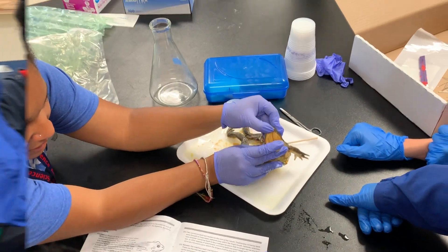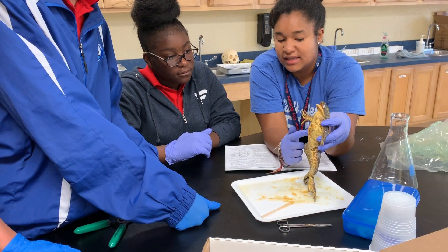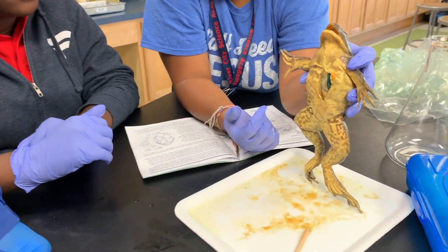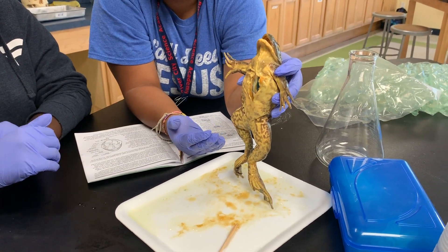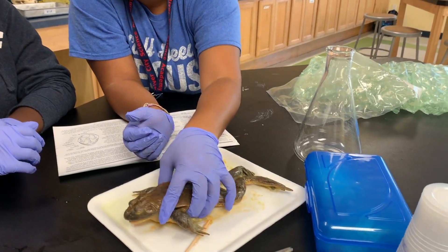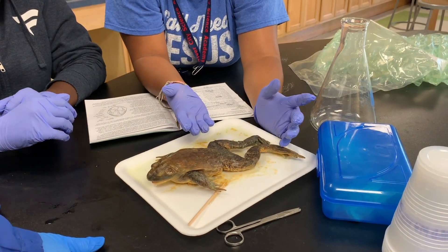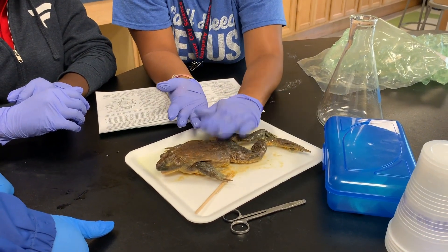Yes — those relate to the fitness and survivability of the frog. Why do you think the frog is this color on the bottom? Camouflage — for water, right? So if the frog is swimming and something is looking up from below, he blends in. And why does the frog look like this on top? For land — so when he's on land he blends in with the mud, rocks, and terrain.